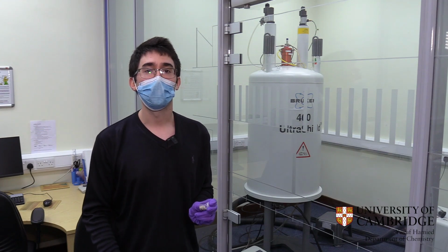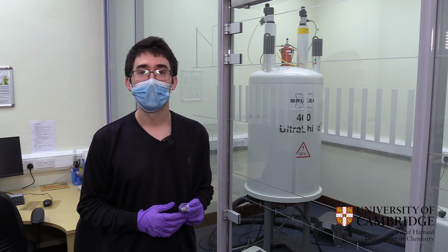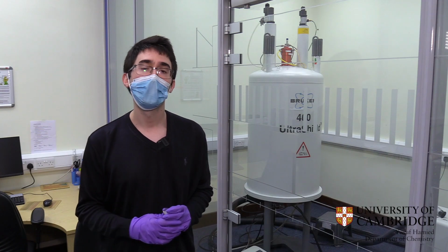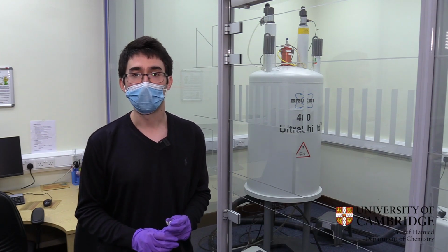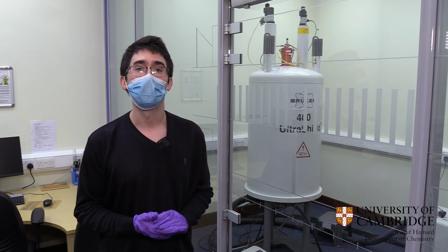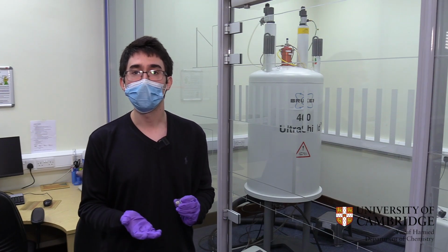This is the machine that is used only by our group, but we actually have access to another 400 MHz NMR machine that is used by another group as well, and we also have access to a stronger magnet of 700 MHz. Moreover, the department has great solid-state NMR facilities, and the people who are working for the NMR service are of great help always.